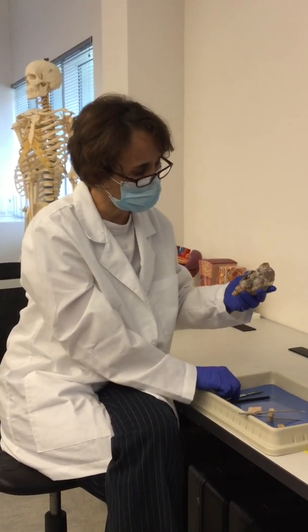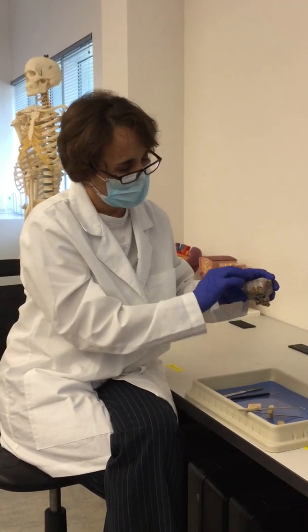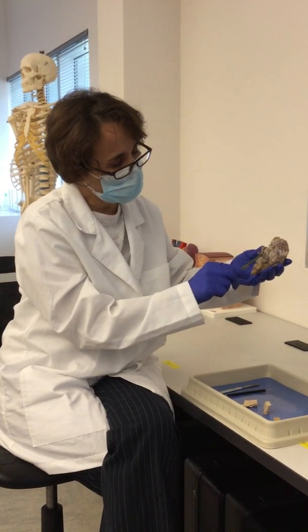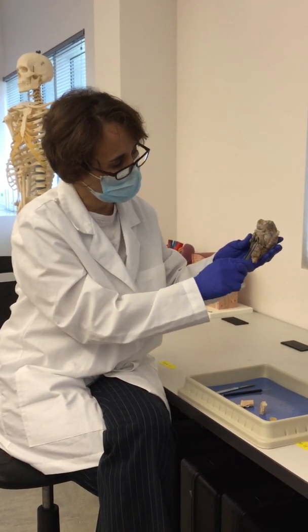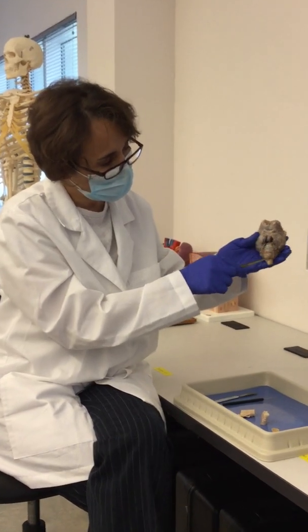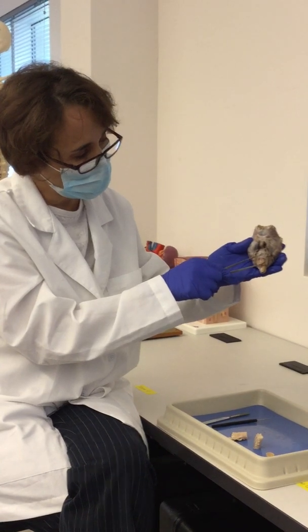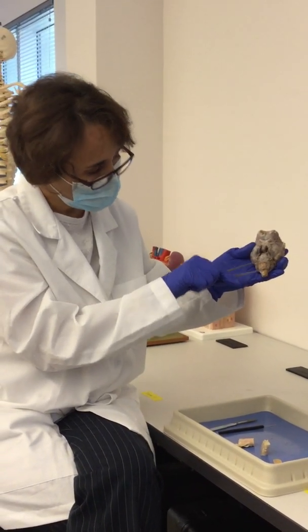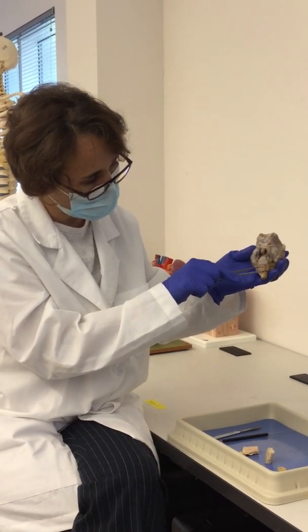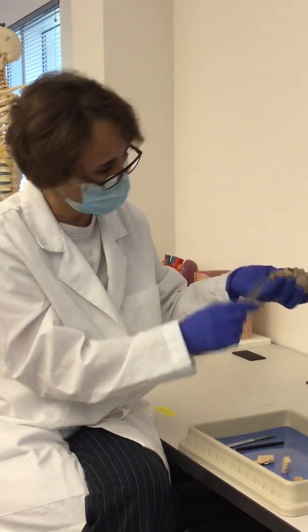So in order to see the internal structures of the brain, we have to remove these meninges. But before that, this is where we have the base of the brain. Here we have the pituitary gland, the hypothalamus. Then this part of the brain is called the brainstem, and within the brainstem we have the pons, and then the medulla oblongata, which will be somewhere around here, and then the spinal cord down here.